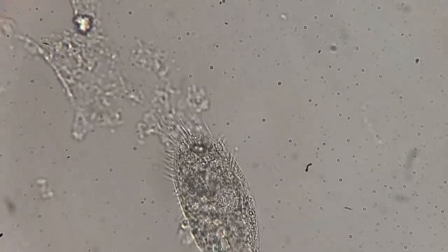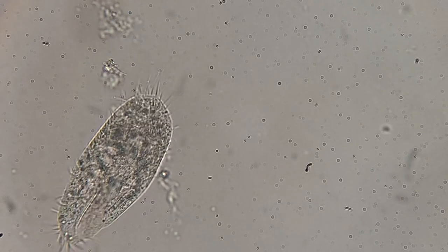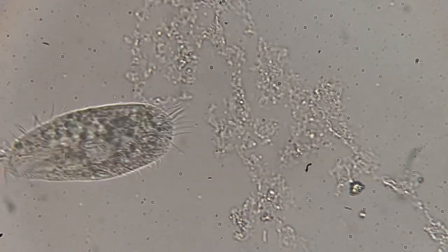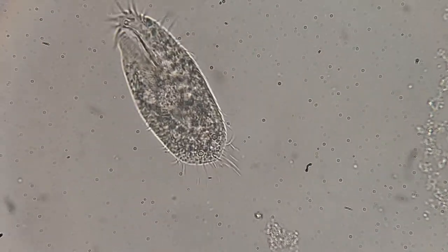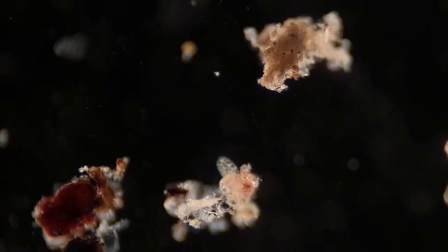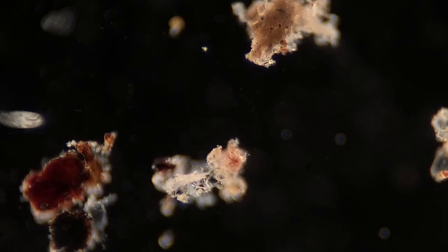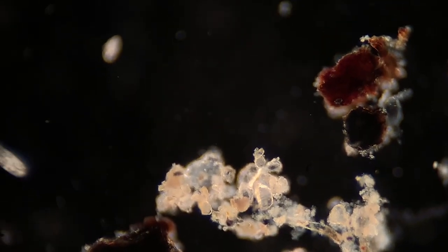Here's a closer look at one of those spirotrichs. You can kind of see it crawling across the glass slide here, and I was having a hard time keeping up with it. When I'm zoomed in at the closest magnification, these guys can really leave the screen pretty quickly. This one was really nice and moving pretty slowly. Most of my stuff that I really like to look at is in the dark field, so here is some more footage of the spirotrichs moving around.